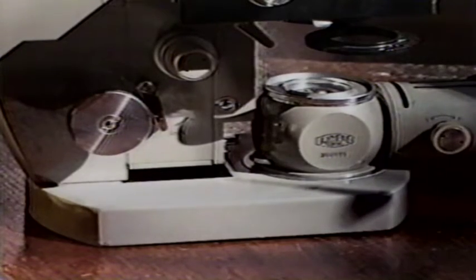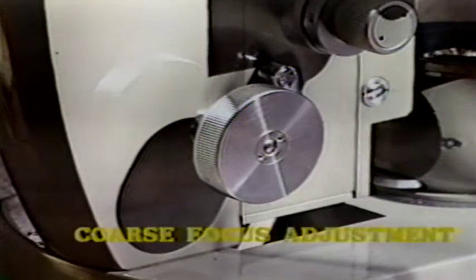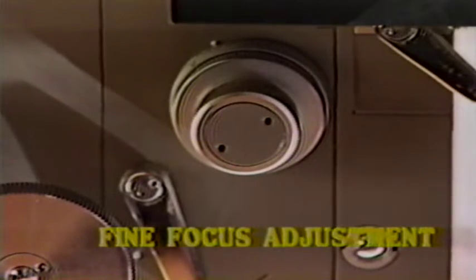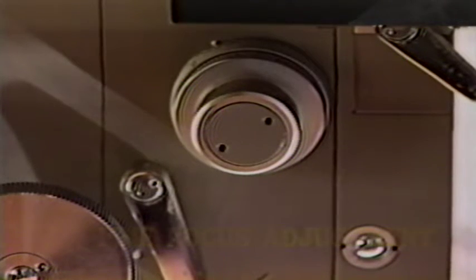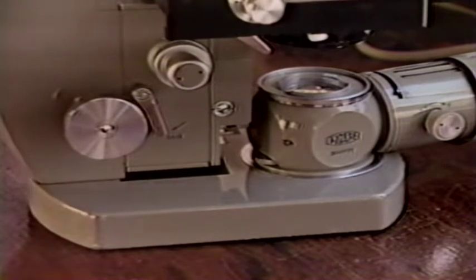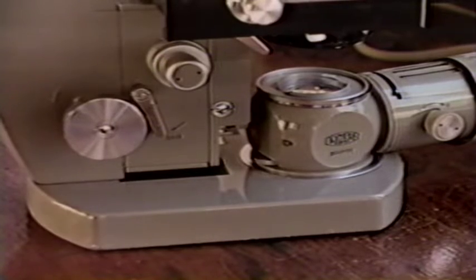Three other major control knobs are found on most compound microscopes. The largest knob is for the coarse focus adjustment, and the adjacent smaller knob is for fine adjustment of the focus. These two knobs control the vertical movement of the objective lenses by moving the body tube to which they are attached.